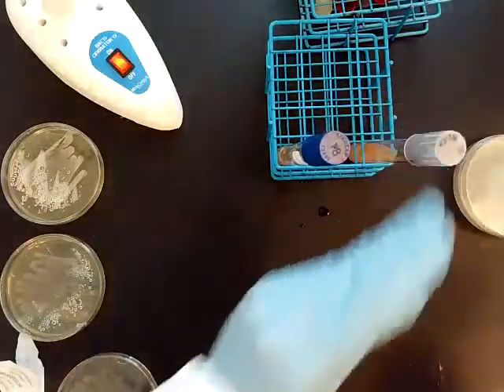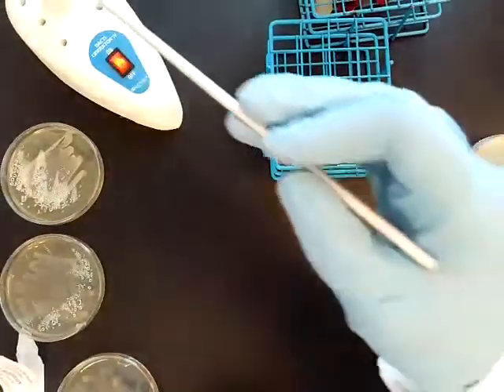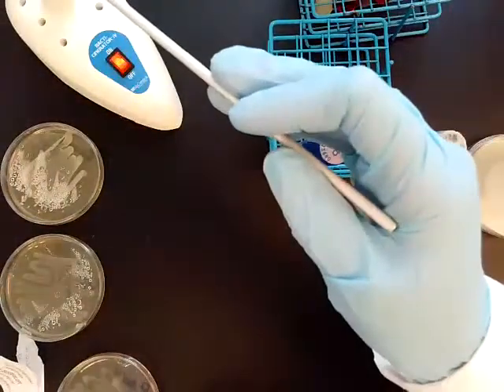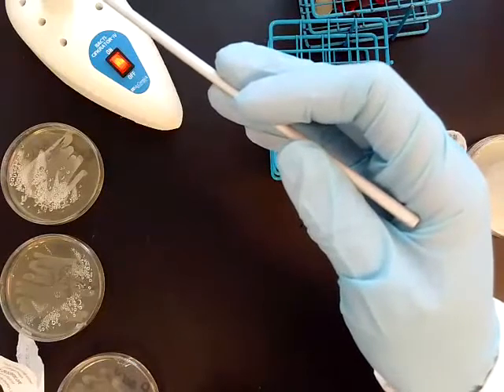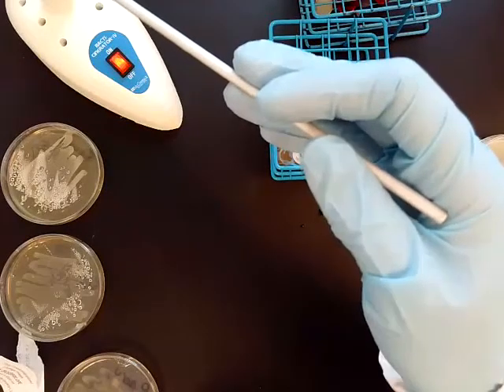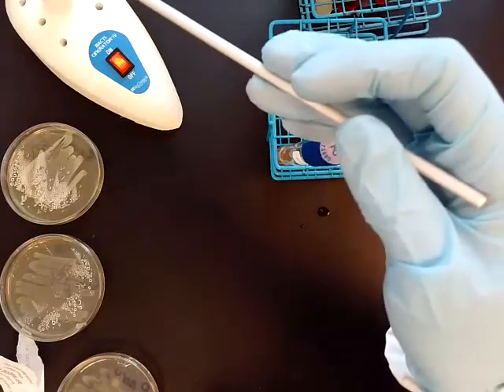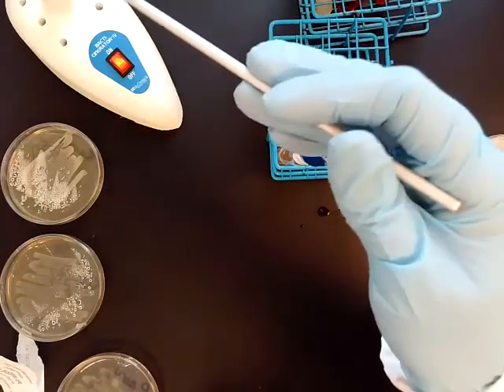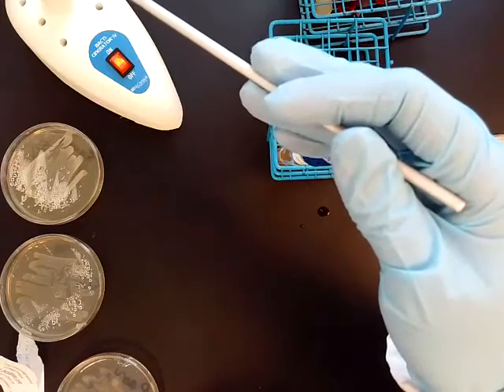These are now going to be incubated. The plates get incubated upside down, and the tube is incubated on a rack in the incubator at 37 degrees Celsius for 24 to 48 hours.